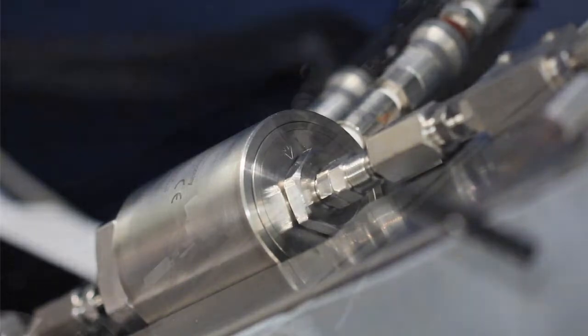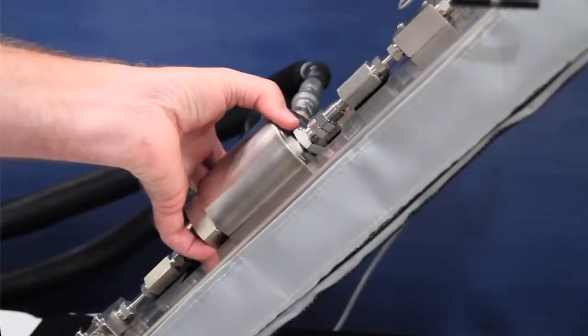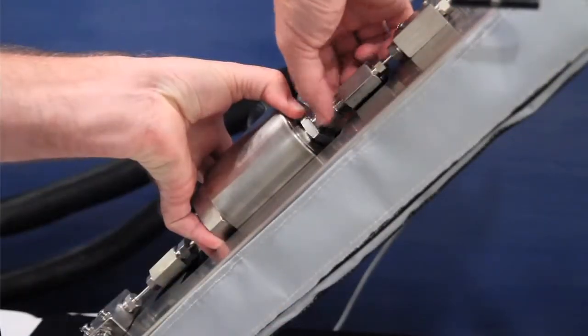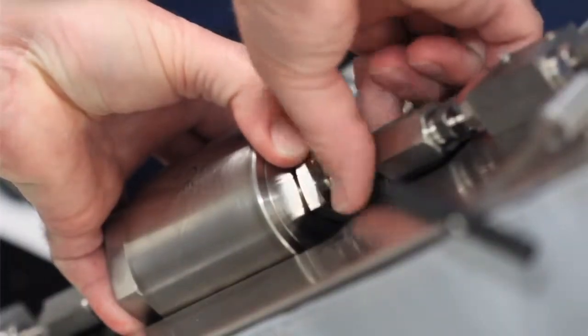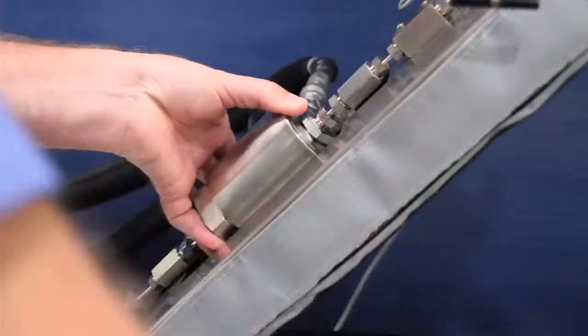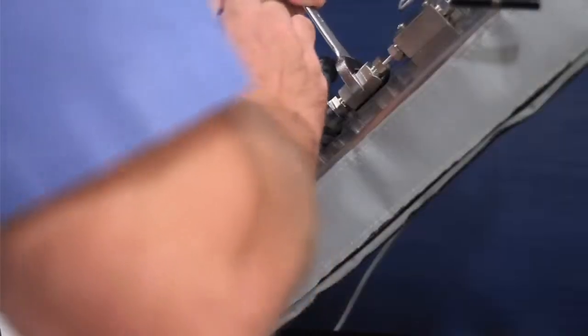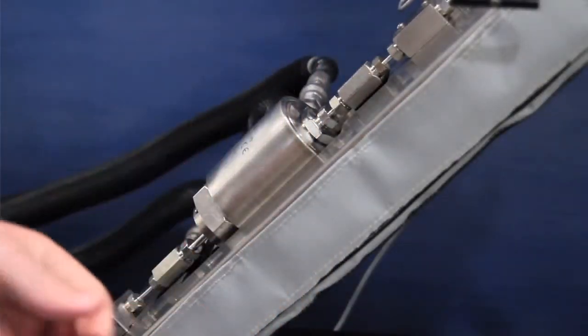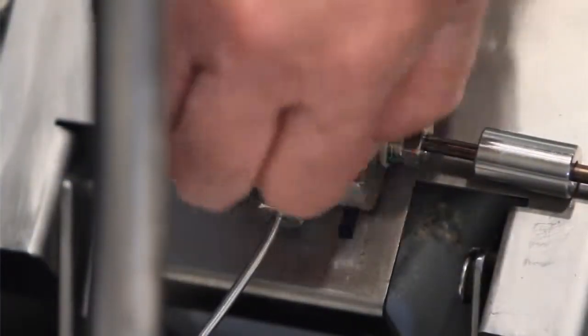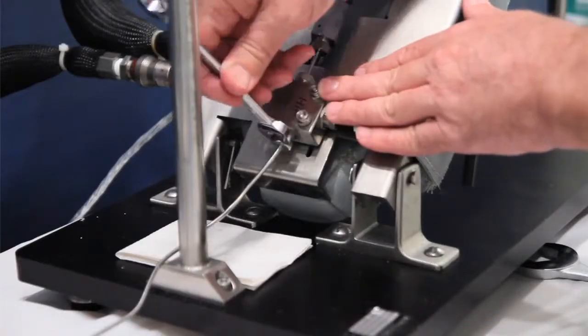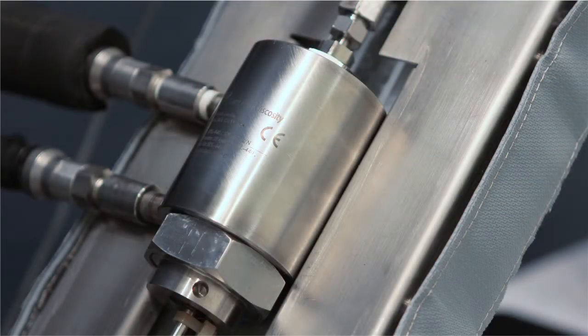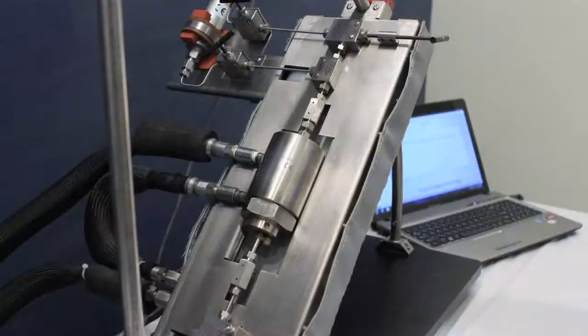Now we will connect the sensor. First, you will need to slide the lower valve up. Next, connect the low torque exhaust nut to the upper reducer by turning clockwise and tightening using the supplied wrenches. After tightening the two thumb screws, connect the sample inlet tube to the lower valve and tighten using the supplied wrenches. The sensor is now installed and the system is reassembled.